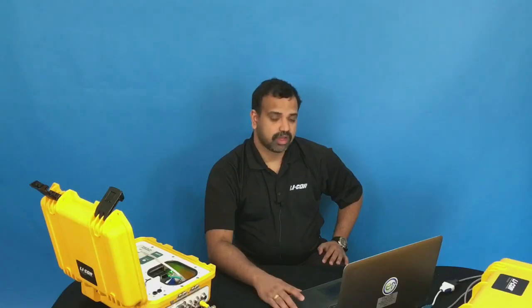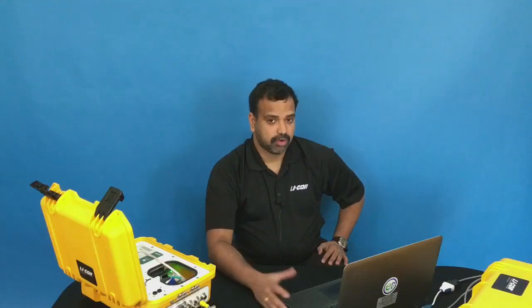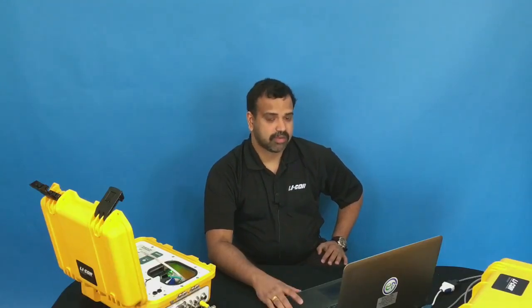So today we've given an overview of how to download the data from the LI-8100 system. For more information, you can always refer to the instruction manual and our website.